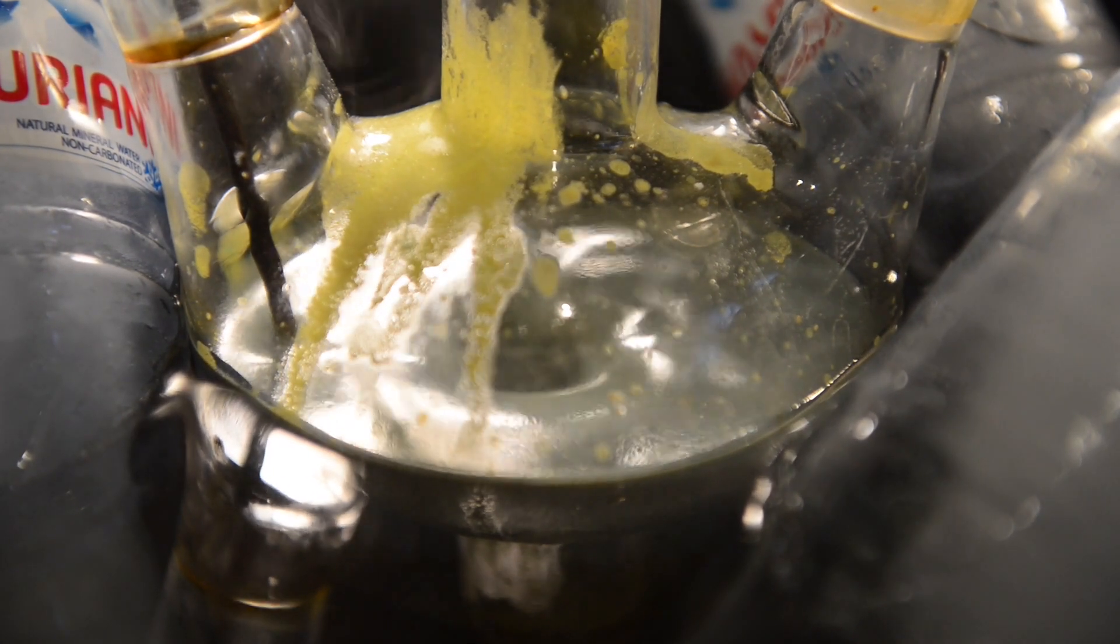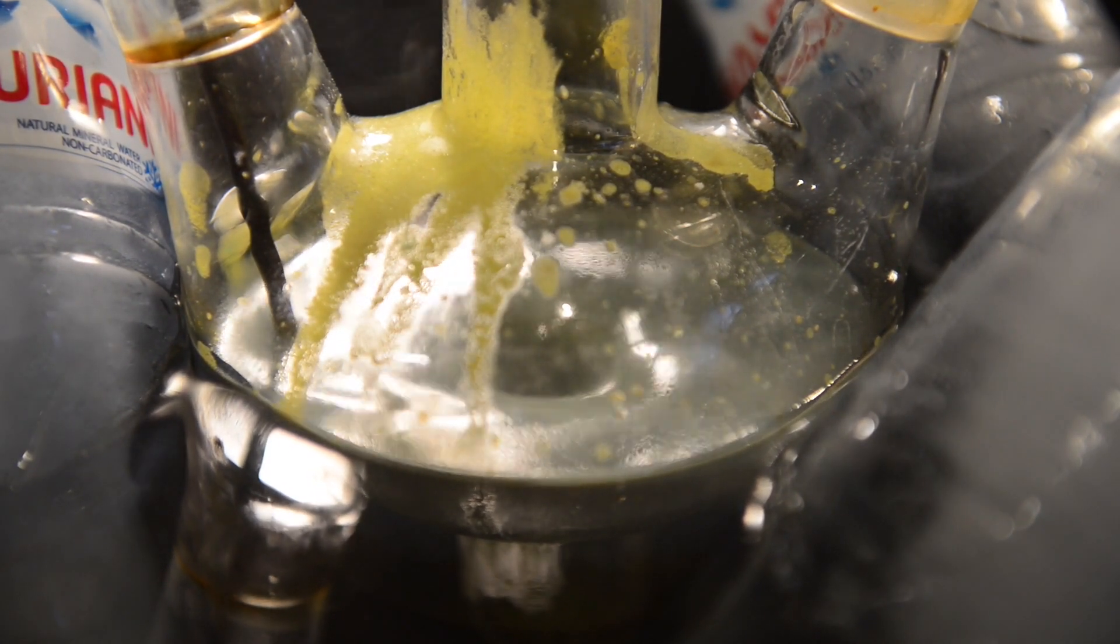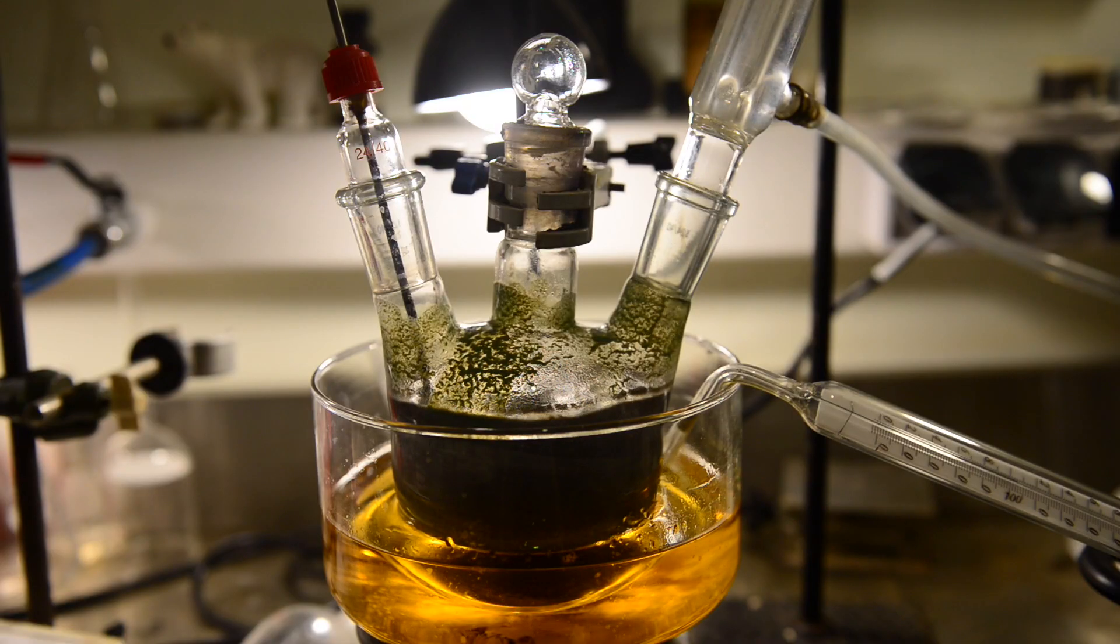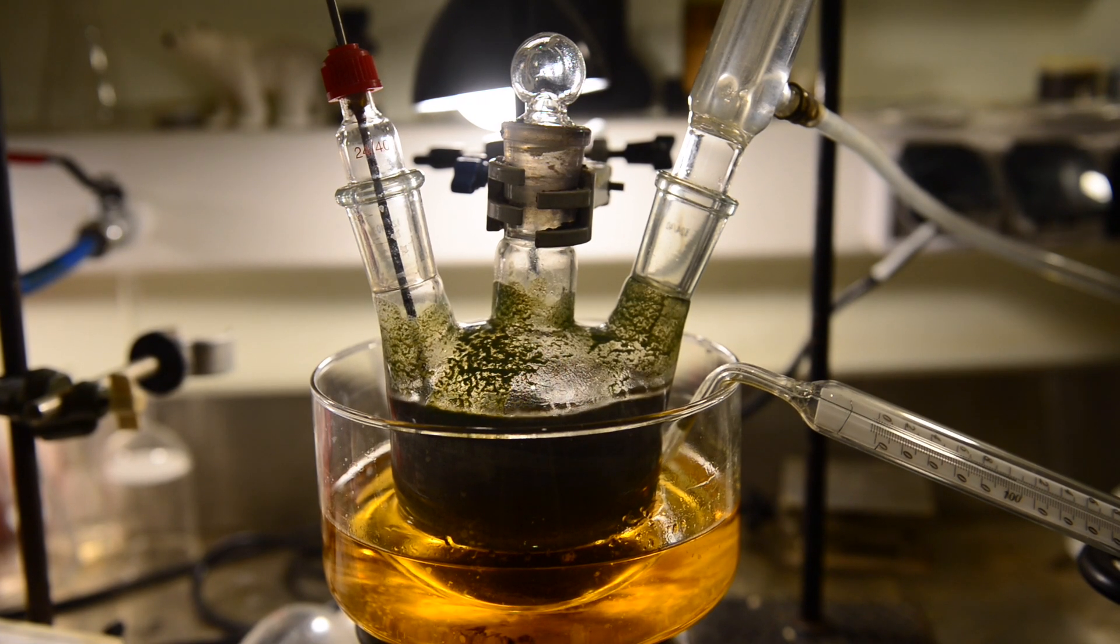Good stirring is absolutely necessary. You must have a very strong magnetic or overhead stirrer to stir the reaction mixture. I'm stirring the reaction mixture at 20 degrees Celsius for one hour.